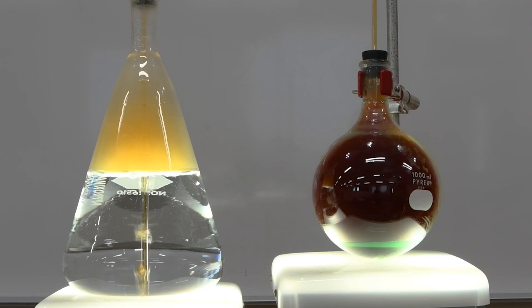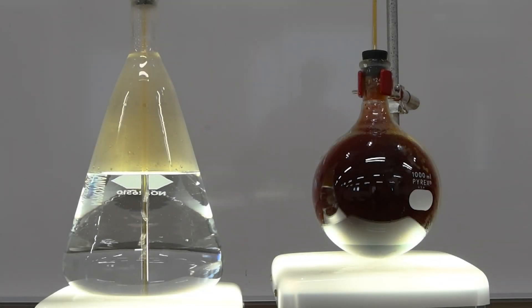Our two pennies will be completely gone. So we'll watch this for a few minutes here. You can see now that the bubbling has slowed down significantly, and the pennies are just about reacted. There's a little piece still floating around on the surface of the nitric acid.